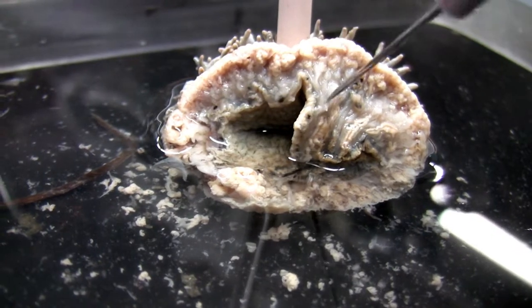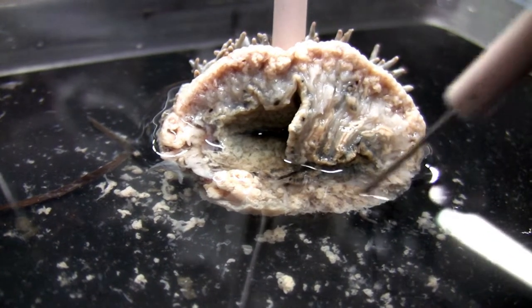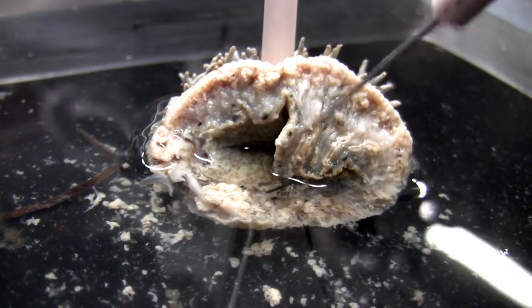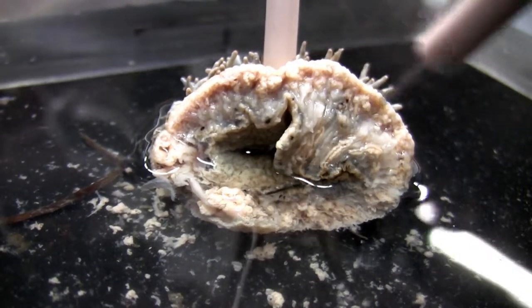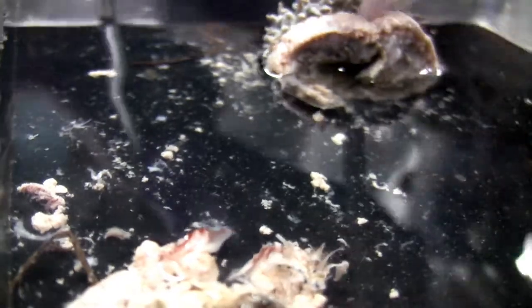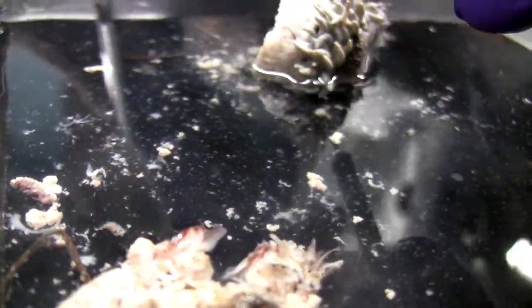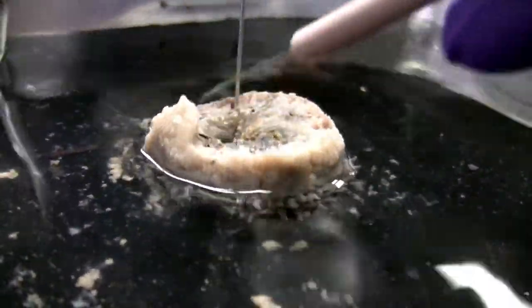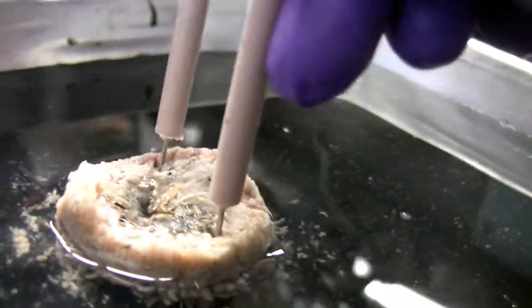It's kind of cool — all that muscle stuff. Muscle. Like this right here. What else are we supposed to do? Longitudinal — I want to do longitudinal. You want to do it down that piece or down this piece? Let's do this guy. Is this cut through the little siphon piece? Yeah.